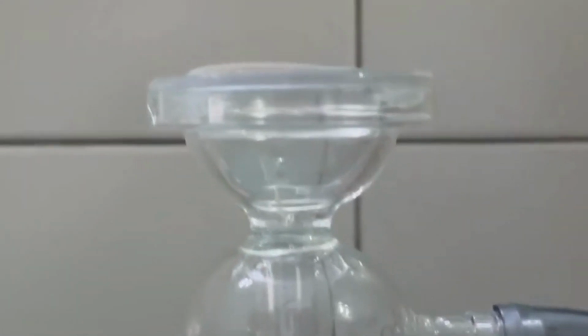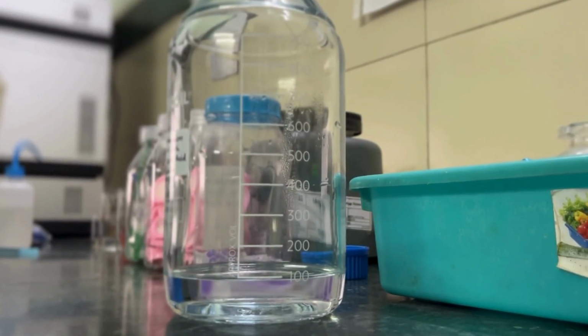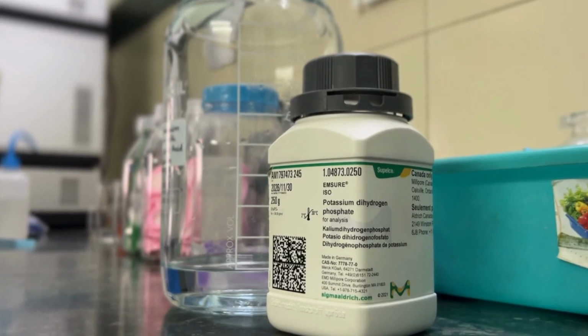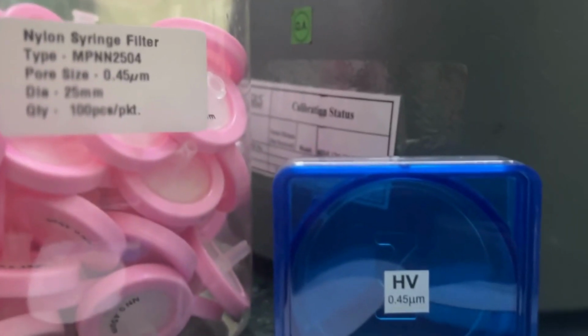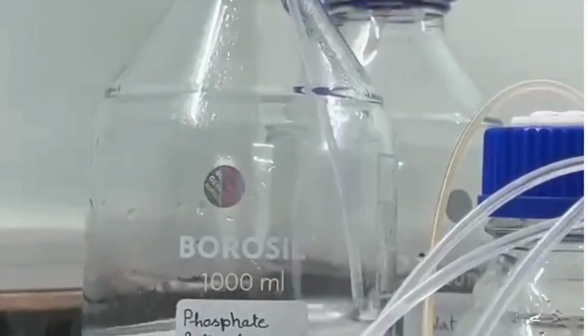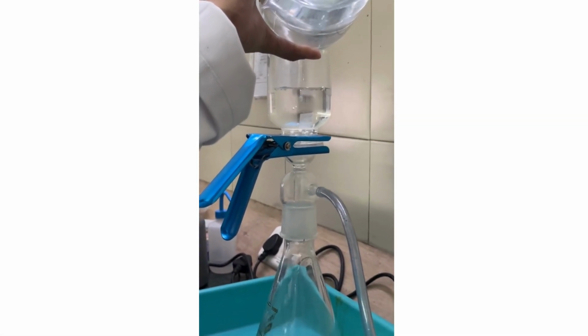To determine the artificial sweetener in a food product, the mobile phase solution includes a phosphate buffer. The allowed particle size in an HPLC column is 0.5 micron, and thus before adding the mobile phase in the reservoir it should be sonicated for about 10 minutes and then filtered in vacuum with a 0.45 filter paper.